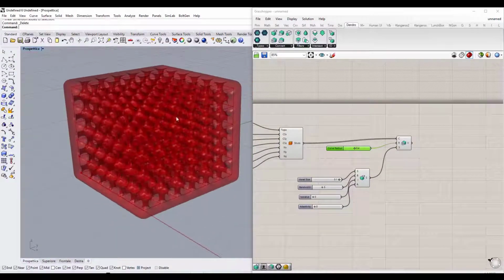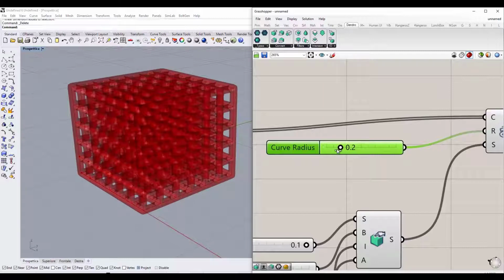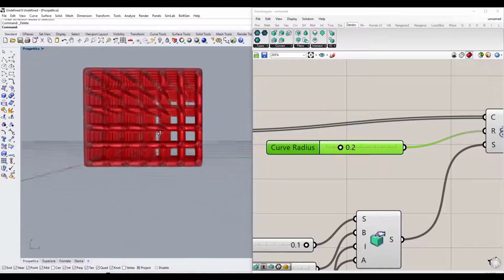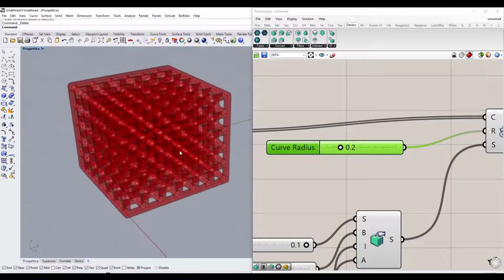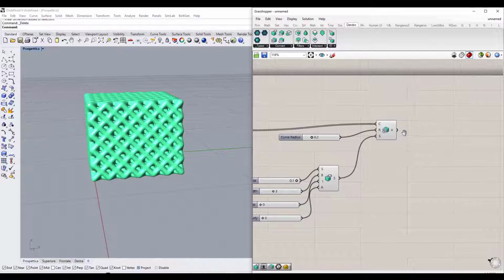Then we can freely decide the rod radius of our scaffold by lowering it, for example, to 0.2 millimeters, thus obtaining a clean scaffold ready to be printed. Okay, now we just have to export our scaffold in STL format, that is the file format used by all 3D printers on the market.